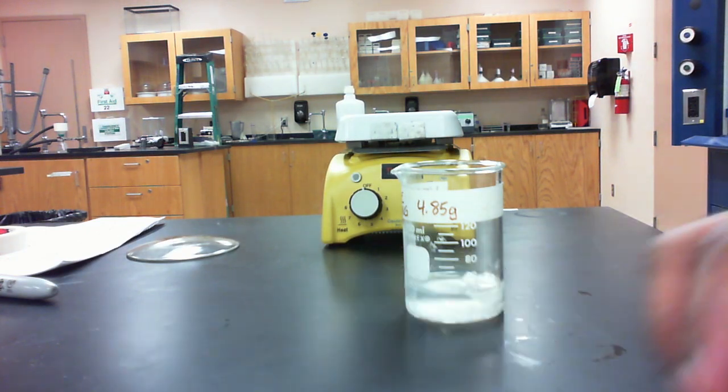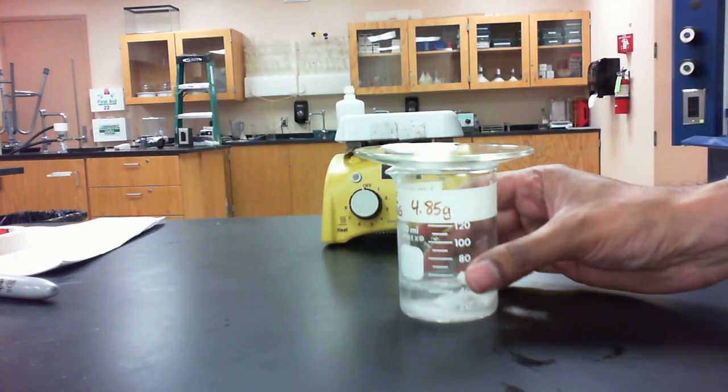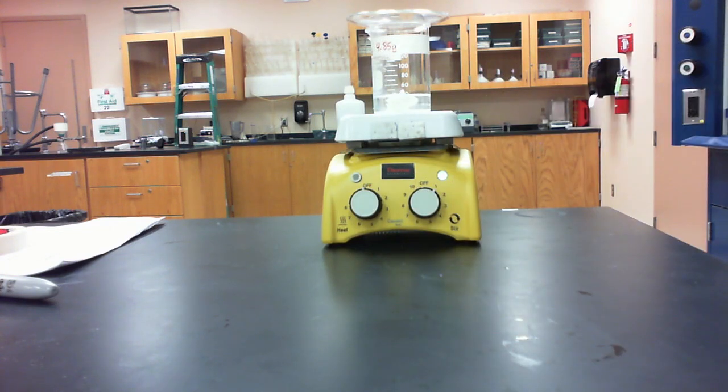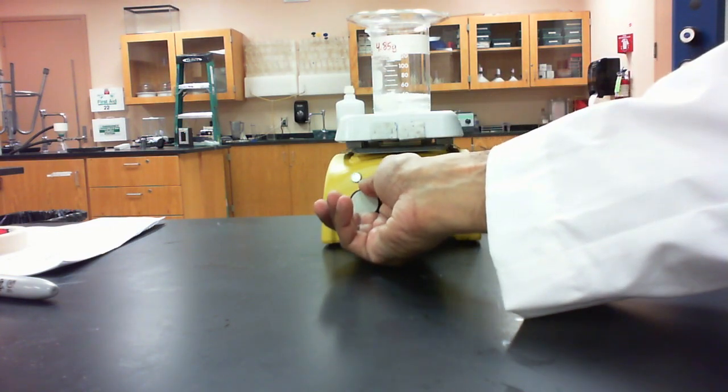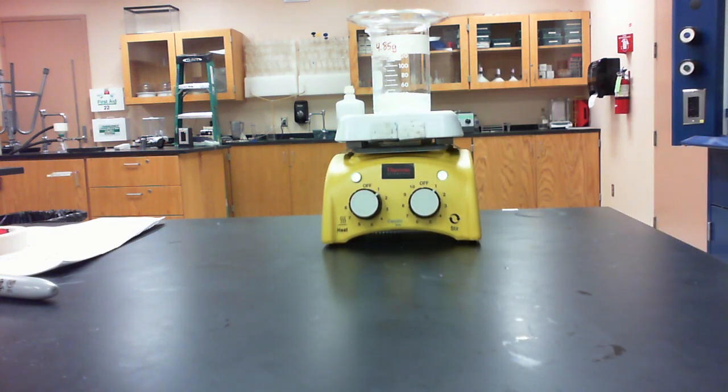We're also going to add a small stir bar to this. We're going to cover it with a watch glass, and we're going to set it on a hot plate, and we're going to turn the stirrer on, and we're also going to turn the heat up a little bit. Right, so this is going to allow the saponification reaction to occur, and as the stir bar stirs, it's going to help mix the solid fat into the solution as time passes by. So we're going to check on this again in about half an hour.